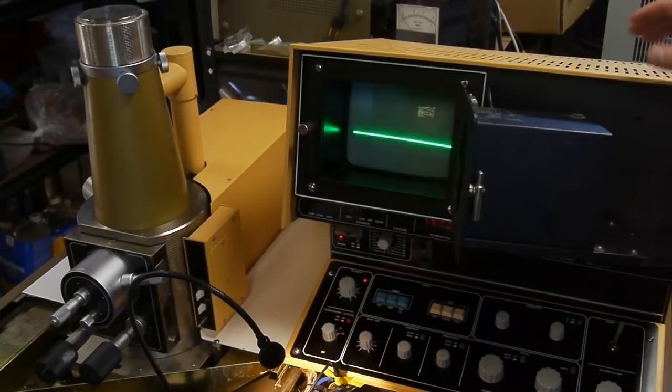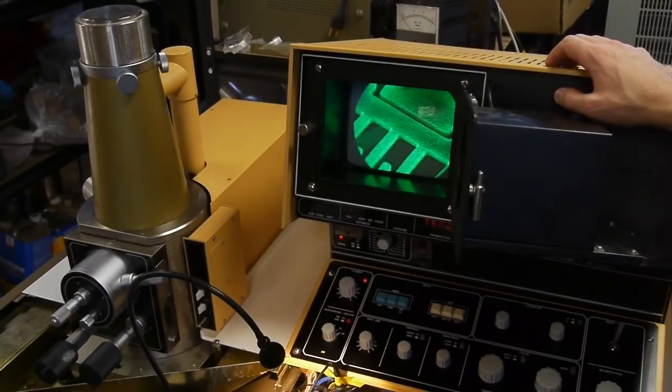This device has three basic modes. It has the full video mode, which is approximately 30 frames a second. And then it has this scan rate, which is about 10 seconds for a full scan.